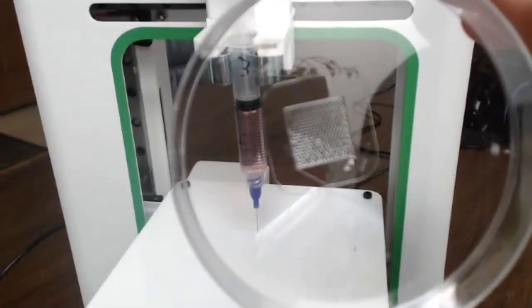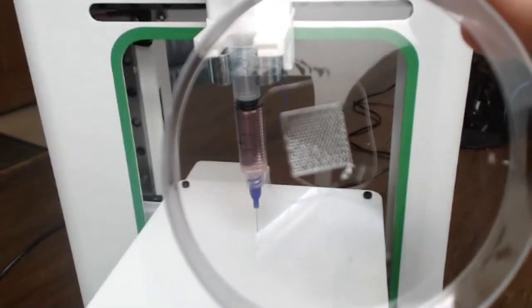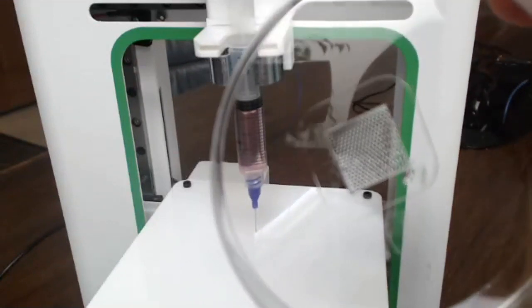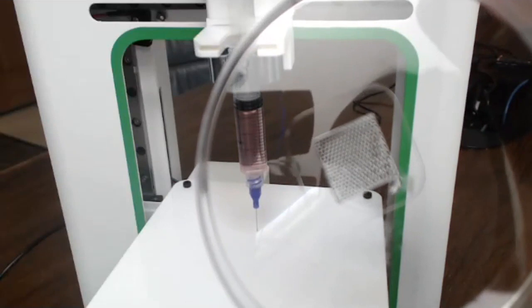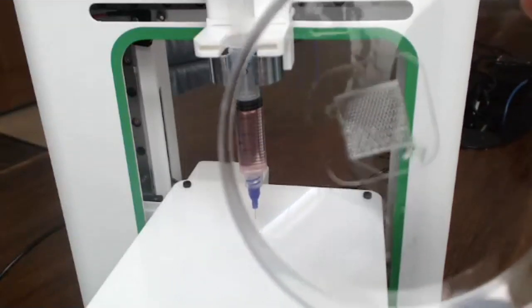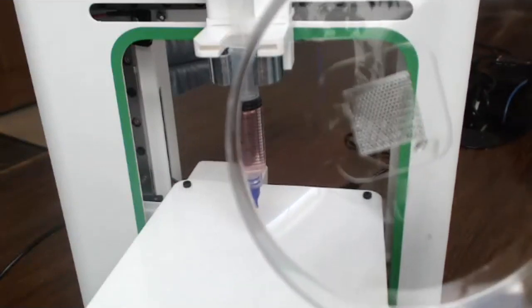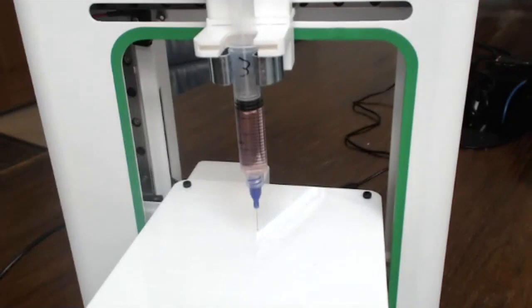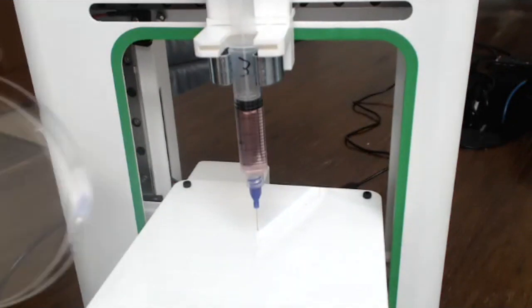So you can see on this scaffold, the resolution is a lot finer than the previous ones, right? With the right speed, we could get a pretty consistent and almost homogeneous pattern across the entire scaffold. So this is the good print. And I think Oliver is going to show you a bad print. If you don't have the right speed, then you won't get such a homogeneous print throughout the scaffold. So we'll show you that by just changing the speed, the print is going to be quite different.